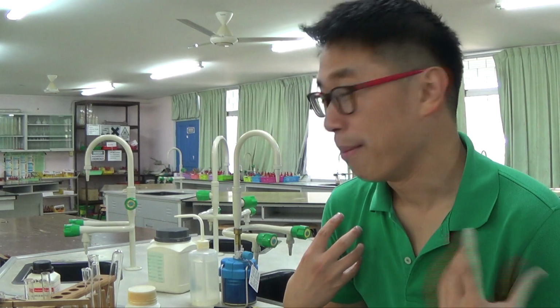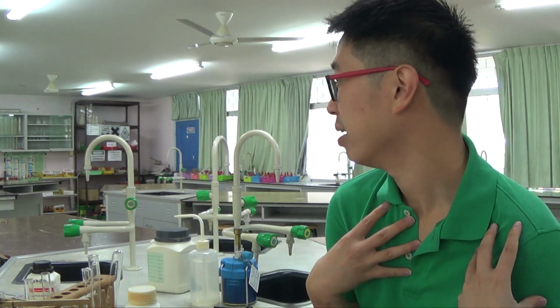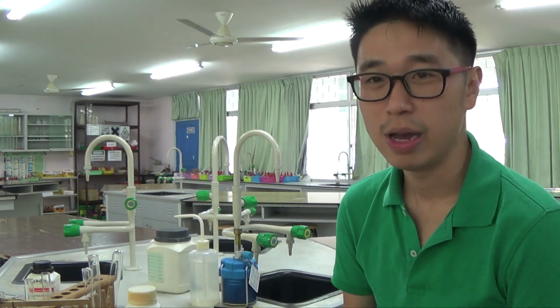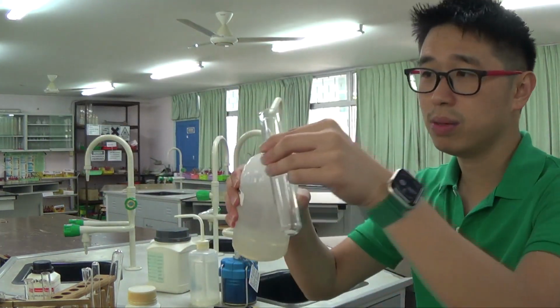Of course, as usual, safety glasses. So I'm not being extremely careful here, but the standard laboratory procedures, safety goggles or safety glasses, and the lab coat are essential. Okay, so I'm not walking the talk here, and it is my bad, it's my mistake. But you should really have a lab coat and safety glasses on as the formal procedure when working in the lab. Right? So I have a bit of this solid here, and I'll dissolve it in distilled water.